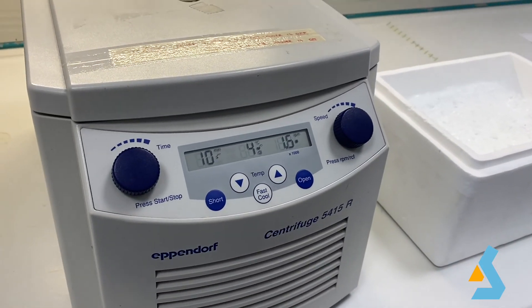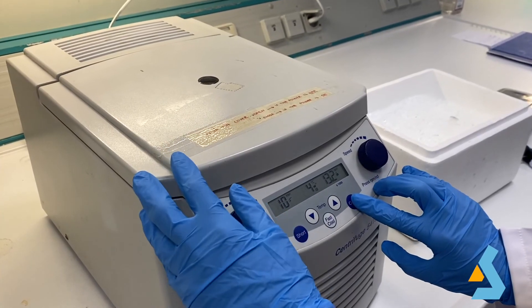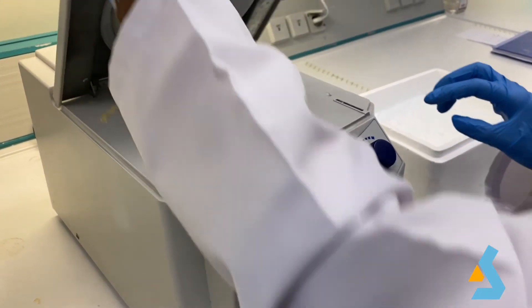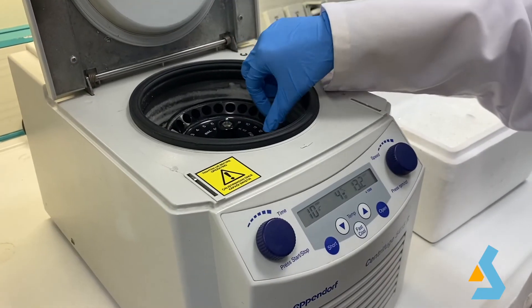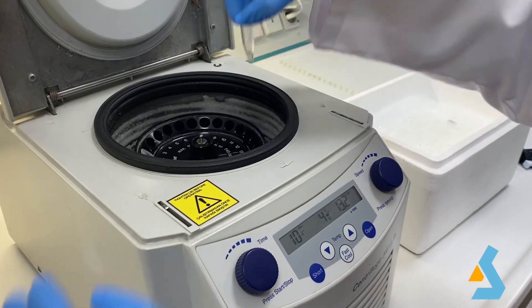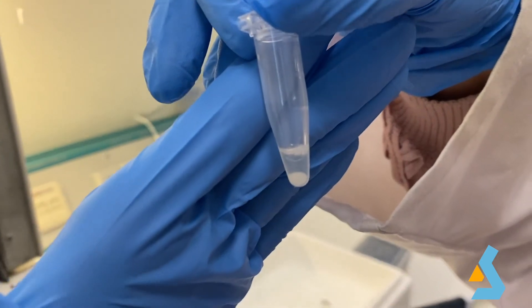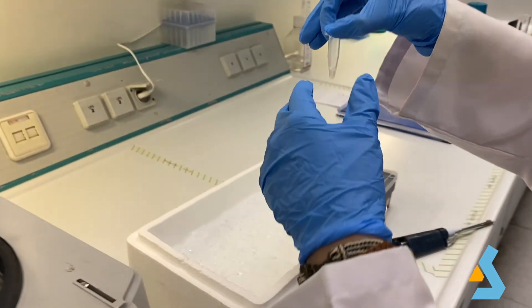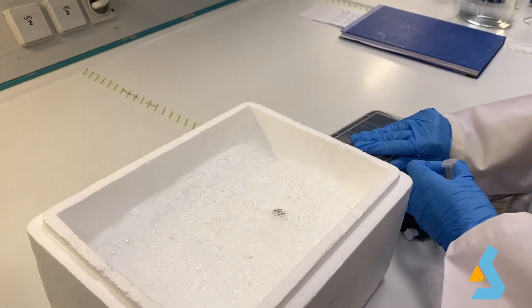Next, we centrifuge at 13,200 RPM for 10 minutes at 4 degrees Celsius. Finally, we transfer the supernatant into a new Eppendorf tube and store at minus 20 degrees Celsius.